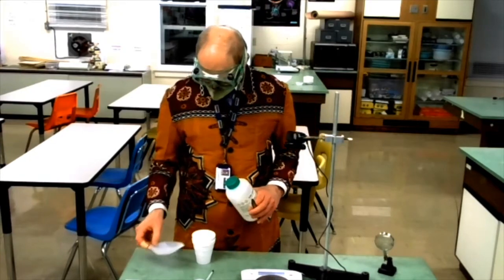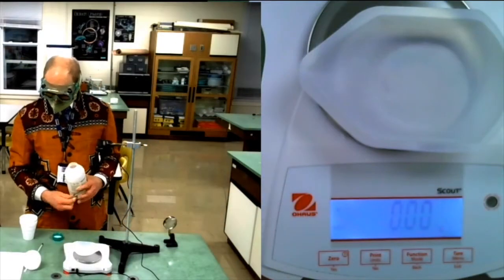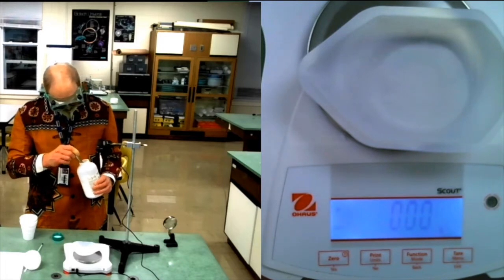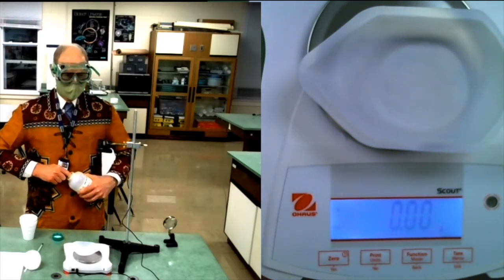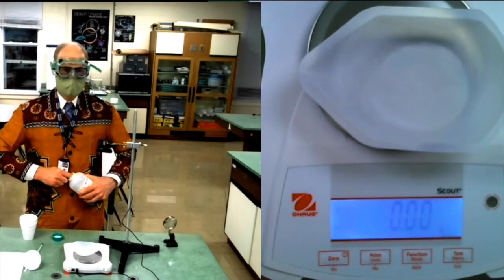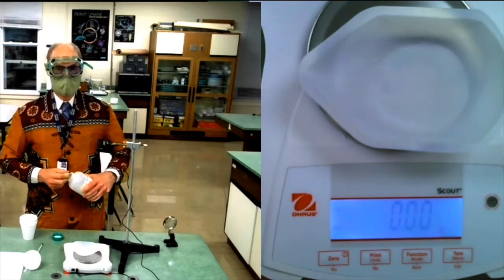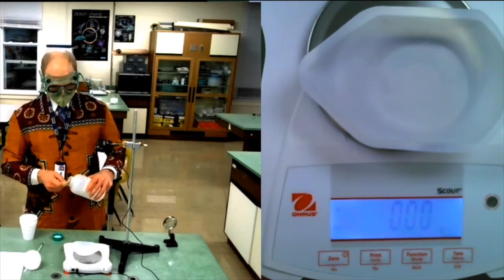Ammonium chloride. Now this is in big chunks, so I'm probably not going to be able to very accurately measure out... Well, I can measure a precise amount, but I can't pick what that amount is very well.